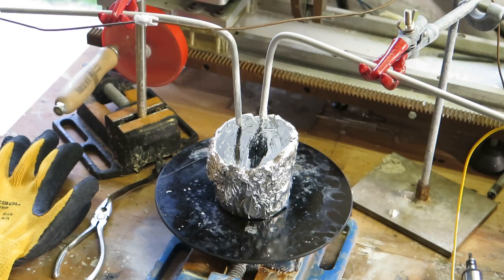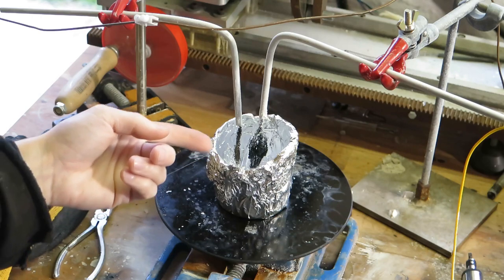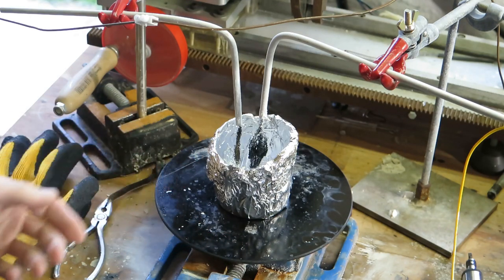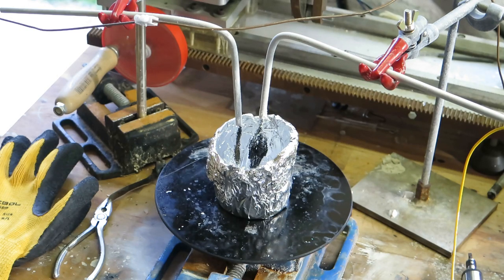Okay, so in this video, I want to check what was the black color that was dissolved in sodium hydroxide when making sodium, since I don't really know. And I have a power supply set up, so I'm going to do it right now.